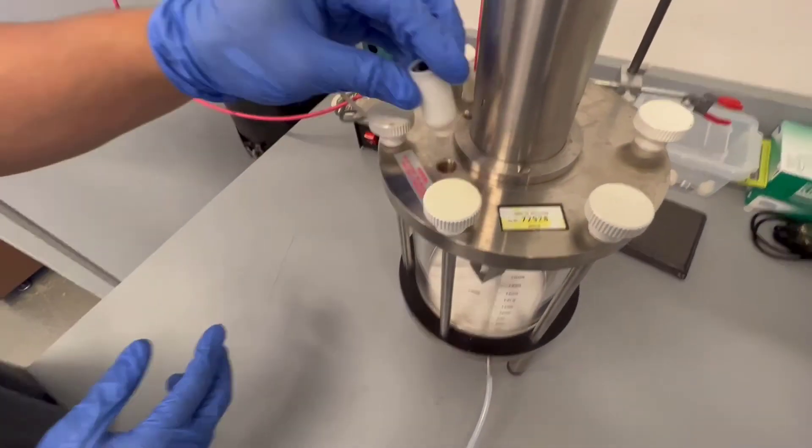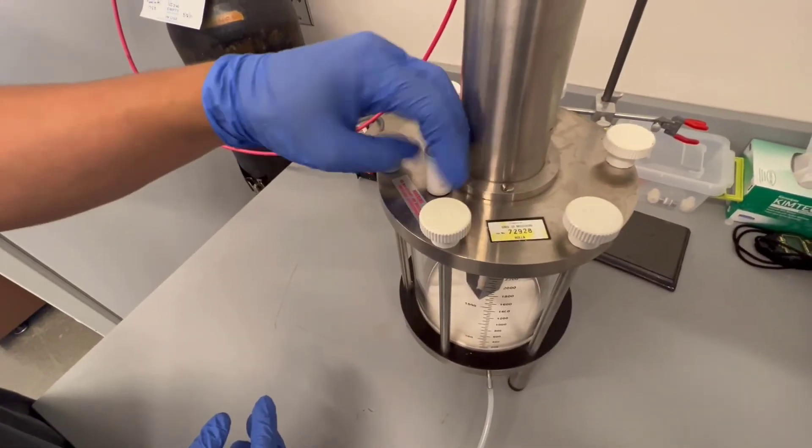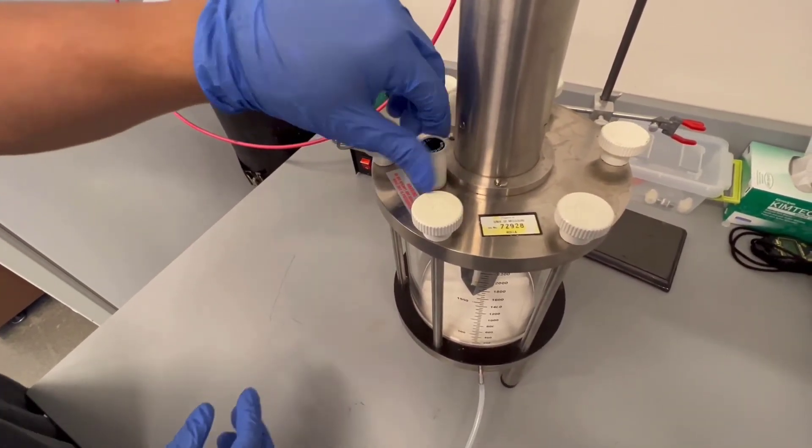After you add your solution, you're going to want to plug it with the pressure relief valve, which will also be used after the process to release the gas.